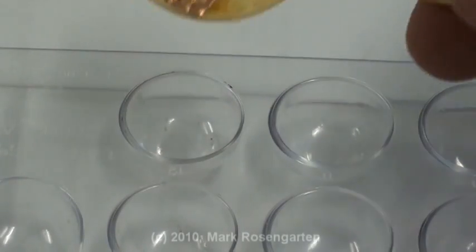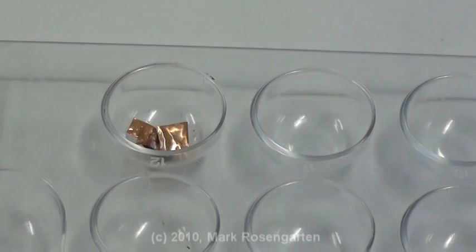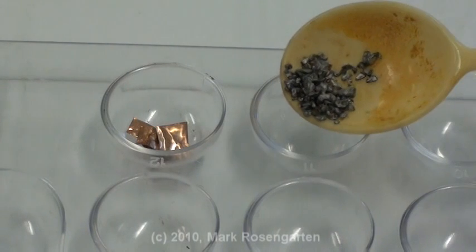Magnesium should replace copper. Now let's actually try that. In the first spot I'll put copper. In the second spot I'll put magnesium.